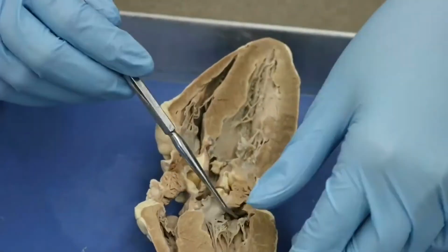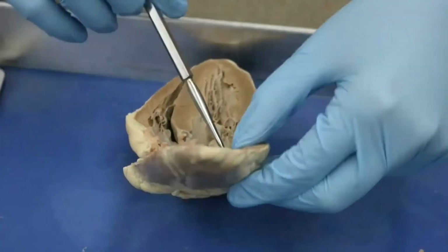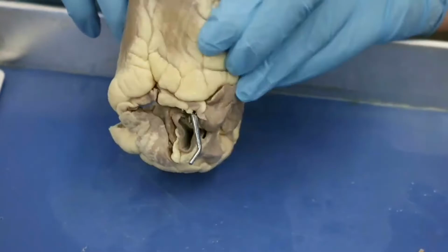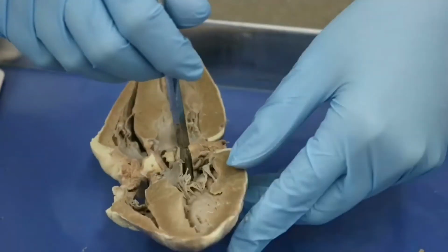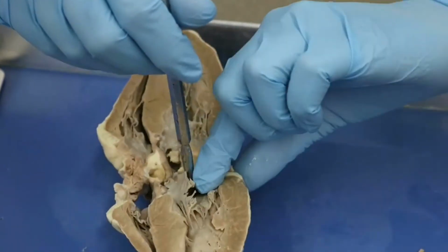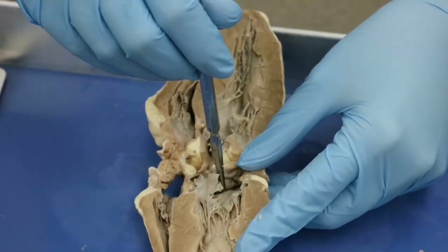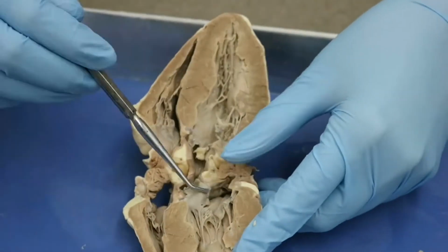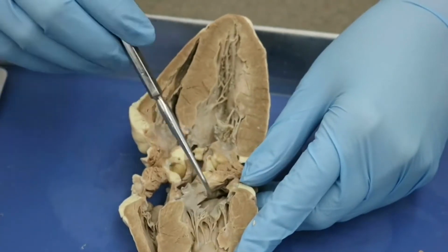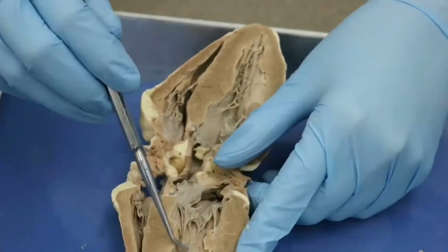So then blood is going to come back into our left atrium from our pulmonary circuit, and let's see, oh, there we go. There's our hole. So this here is going to be a pulmonary vein that is depositing blood from the pulmonary circuit back into our left atrium, okay? Now, within this left atrium, again, we can see the mitral valve we talked about before. We still have our chordae tendineae. We have our papillary muscles.